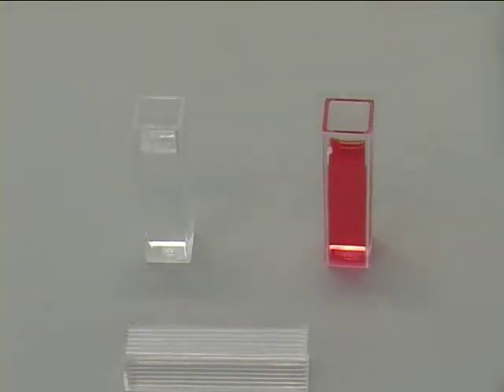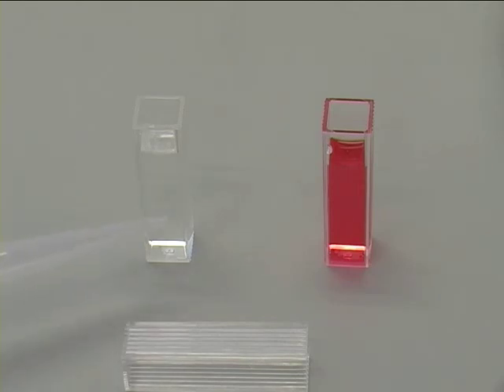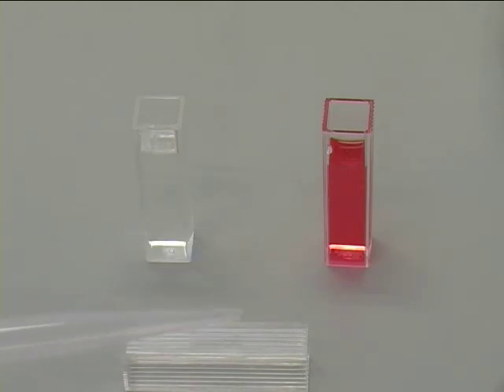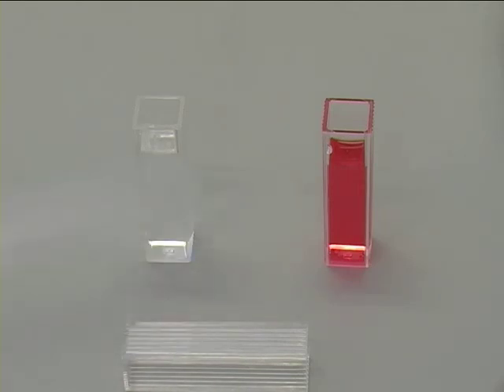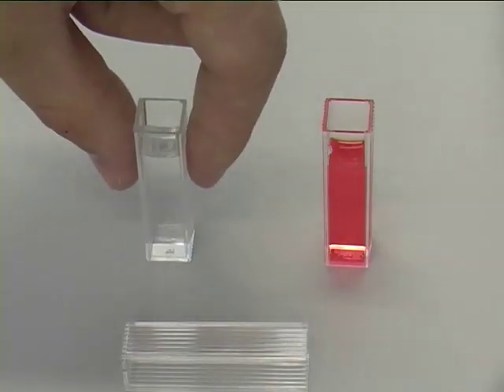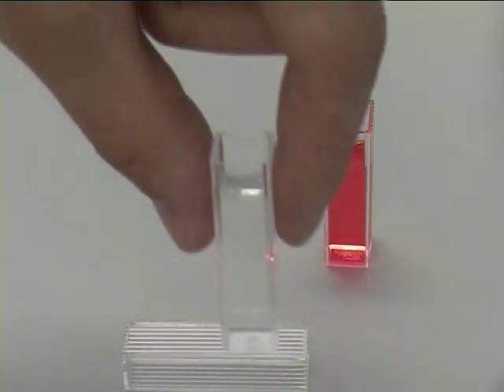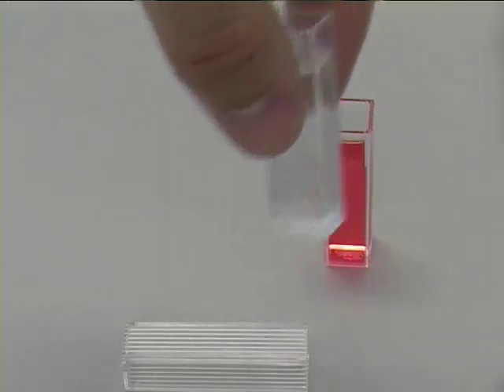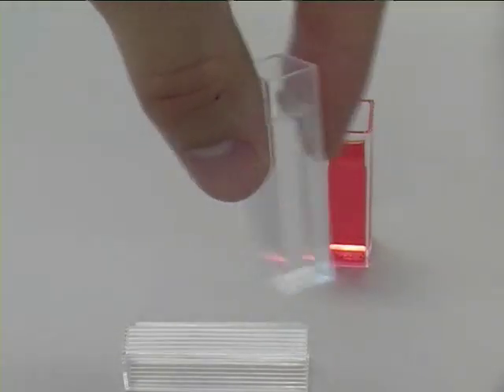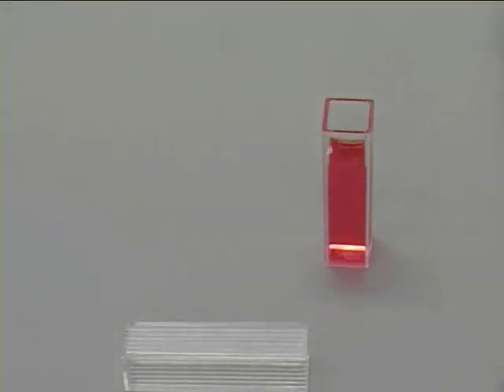Cuvettes used in the colourimeter will either be four or two windowed. Two windowed cuvettes have two clear windows and two ridged sides. These cuvettes should only be handled by touching the ridged sides, and it is important that they are correctly inserted into the colourimeter so that the light beam passes through the clear windows.